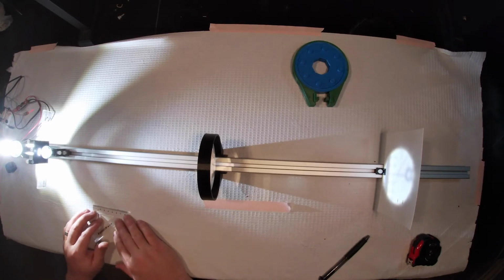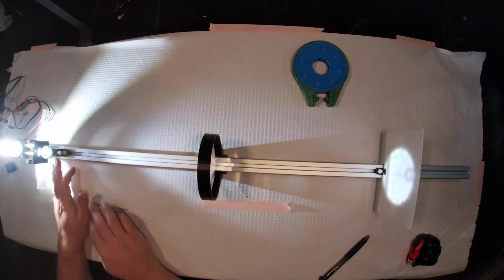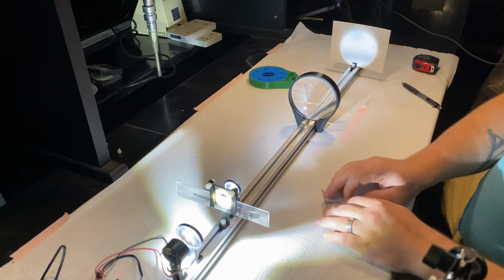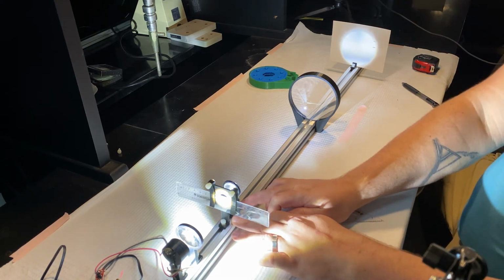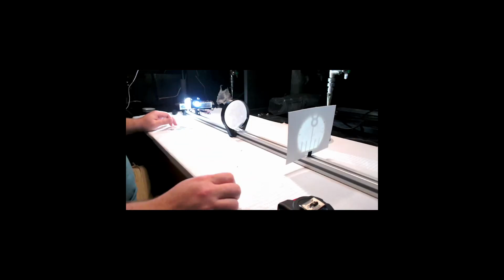What is probably misaligned or out of focus is our objective, right? Because you can see that even a slight adjustment, just a few millimeters, and my image is completely gone. So we'll need to move this very finely to make sure that our sample is exactly one focal length away from our lens, and you can see that we have a nice image of that 8 come into focus.